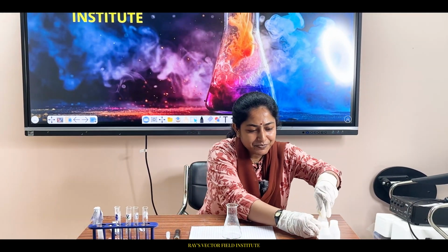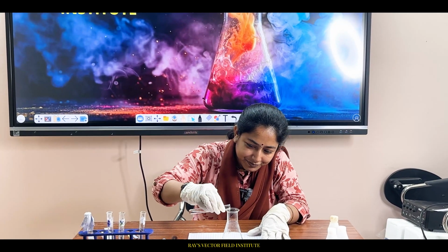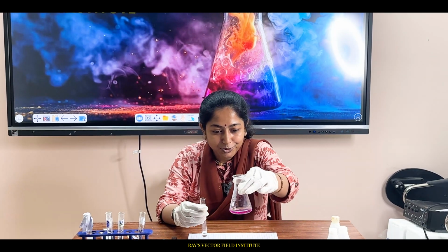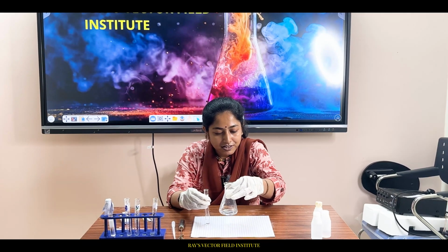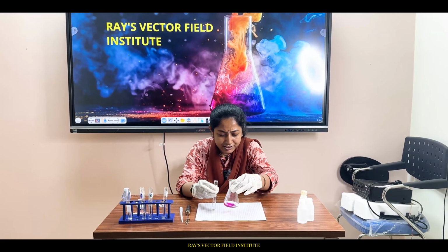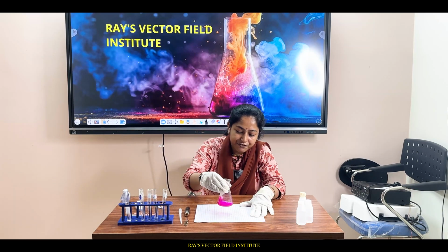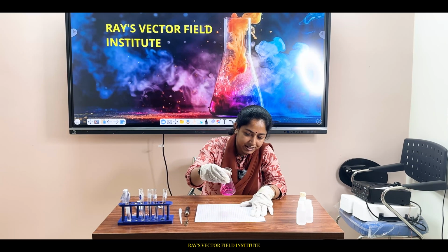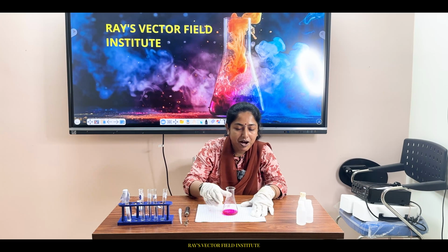Let's add Y again and see what happens. Oh, see, the color has appeared, but let's stir it up. Gone, color gone. Again appeared, and now see, this time it is staying for more time, permanently. Stirring, let's see if it goes or not. But now this deep pink color is permanent.